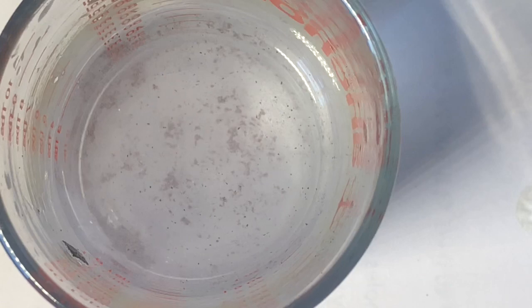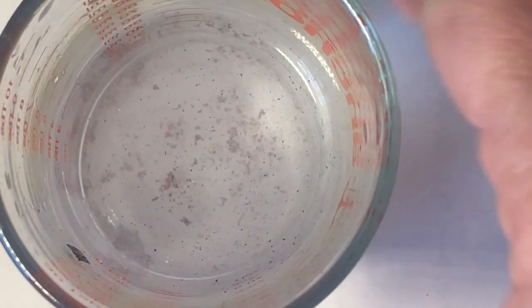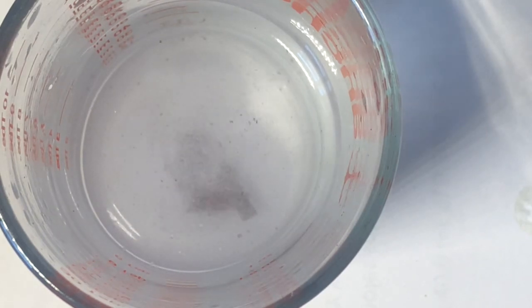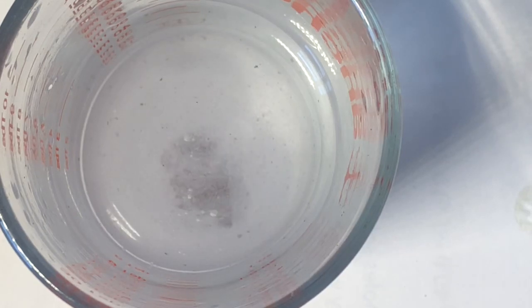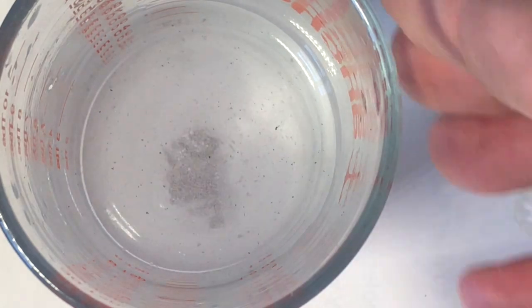All right, once we're happy that we've got all of the magnesium out, the only metal left is the copper. And then we'll just filter this. There's a little bit left in there. We'll filter this and collect the copper for a final weighing. In the lab, we filter in filter paper and put it in the oven to dry for the next lab period, and then we come back and weigh that completely dry product and observe what its appearance is.